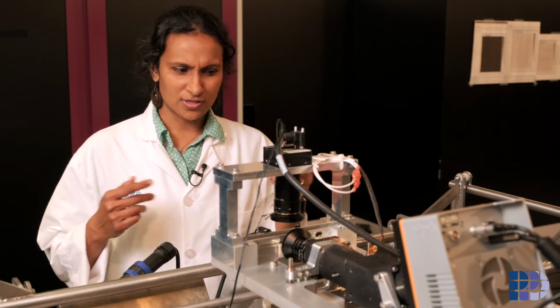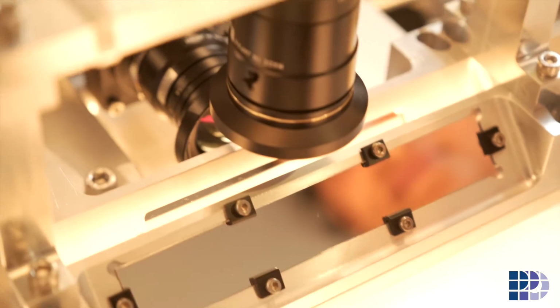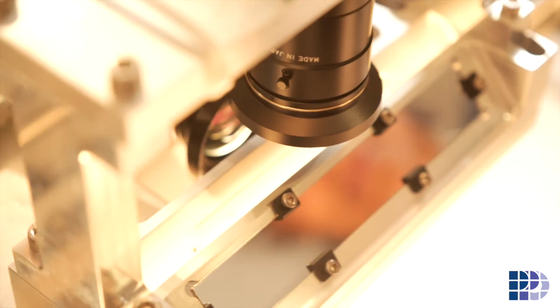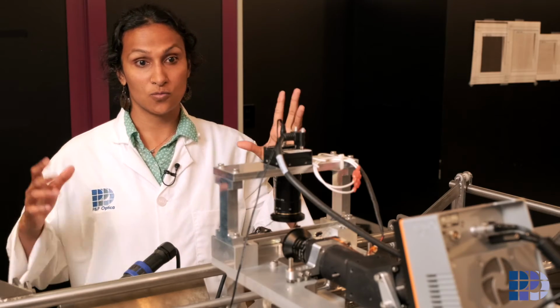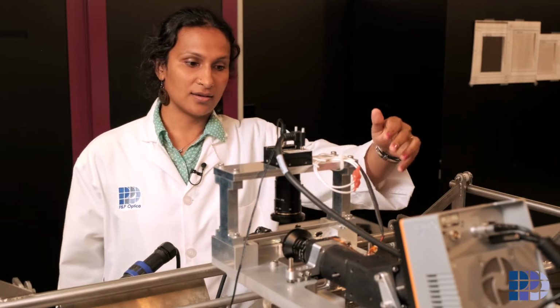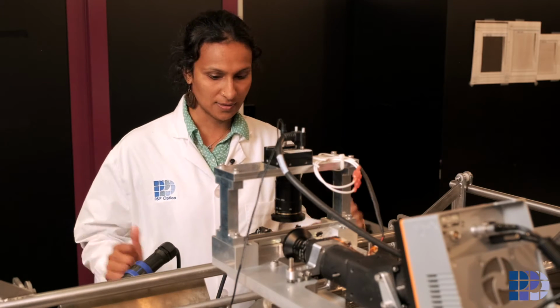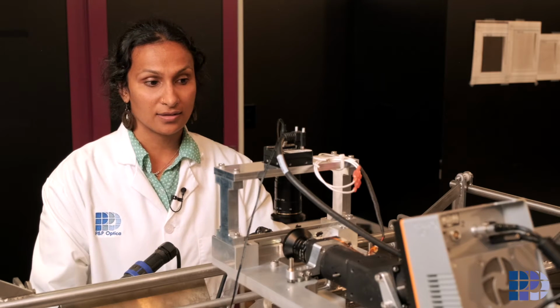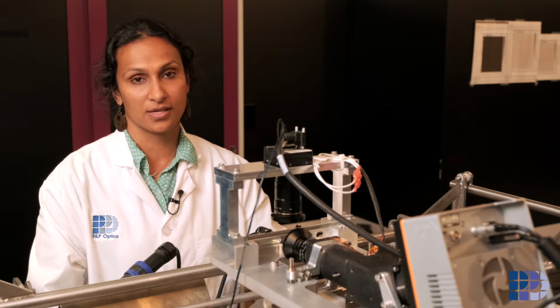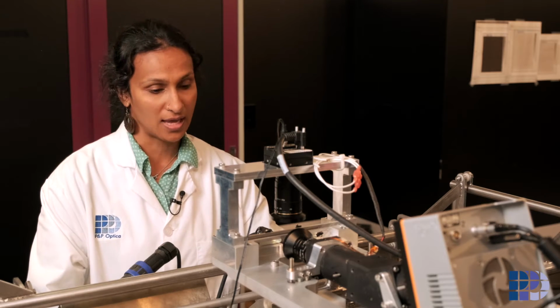So the next question is, how are they both seeing the same scan line? So we have two mirrors here which are specifically coated such that this visible camera receives visible signal, and the spectrometer receives the infrared region of the signal. So the next step is to ensure that the visible camera and the spectrometer are looking at the same object, that is the same scan line.